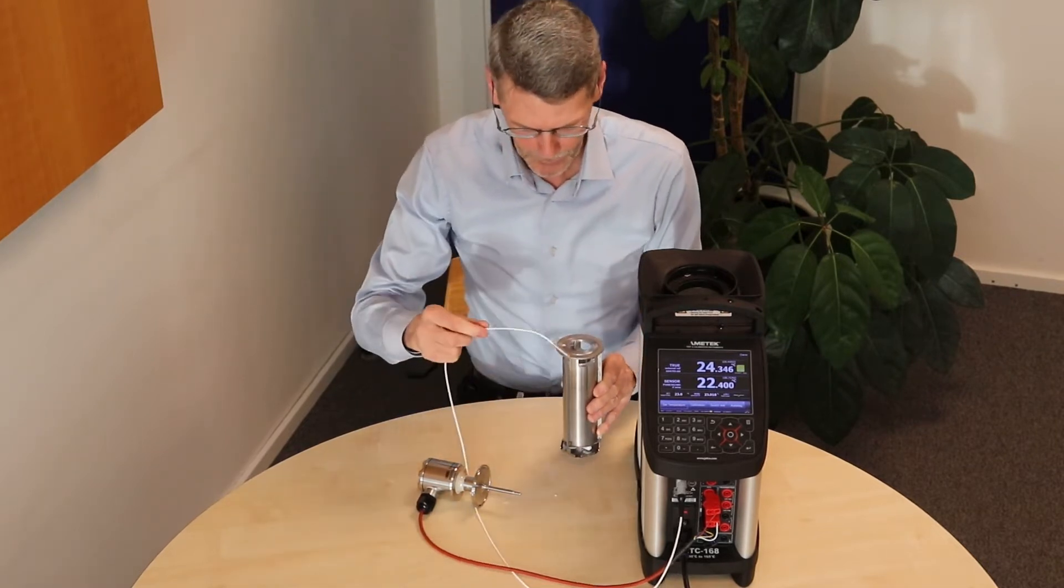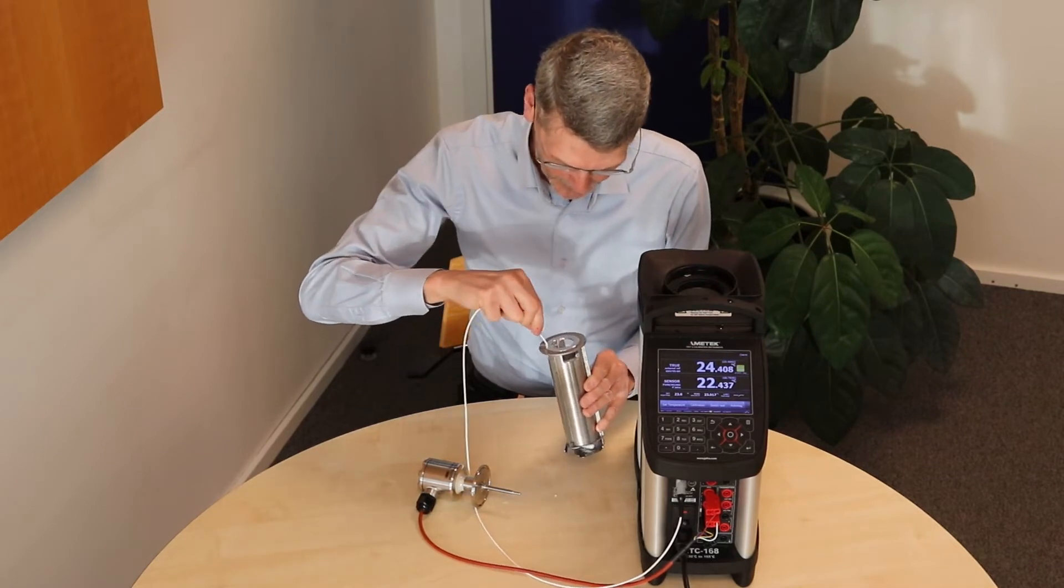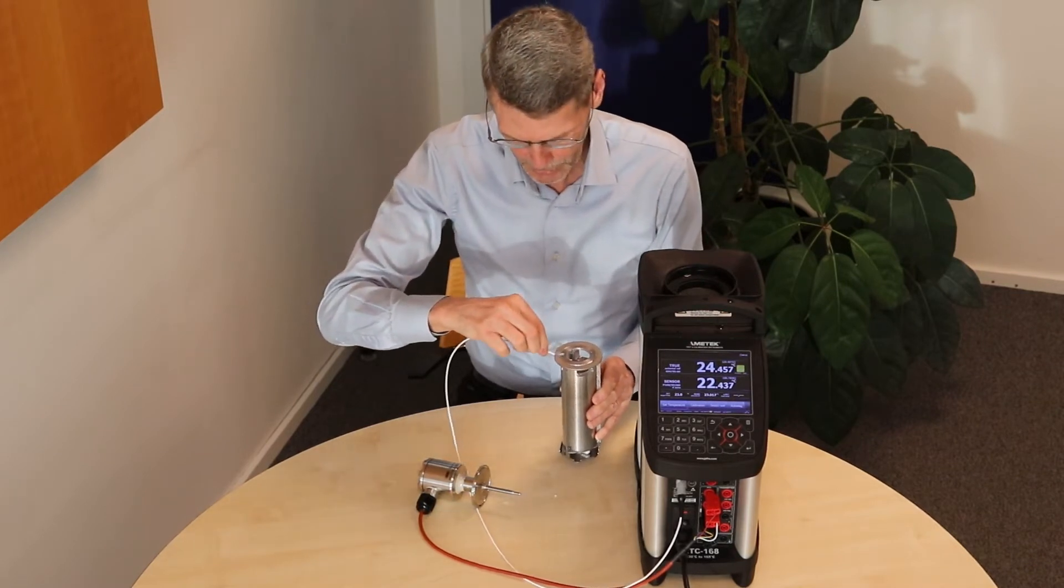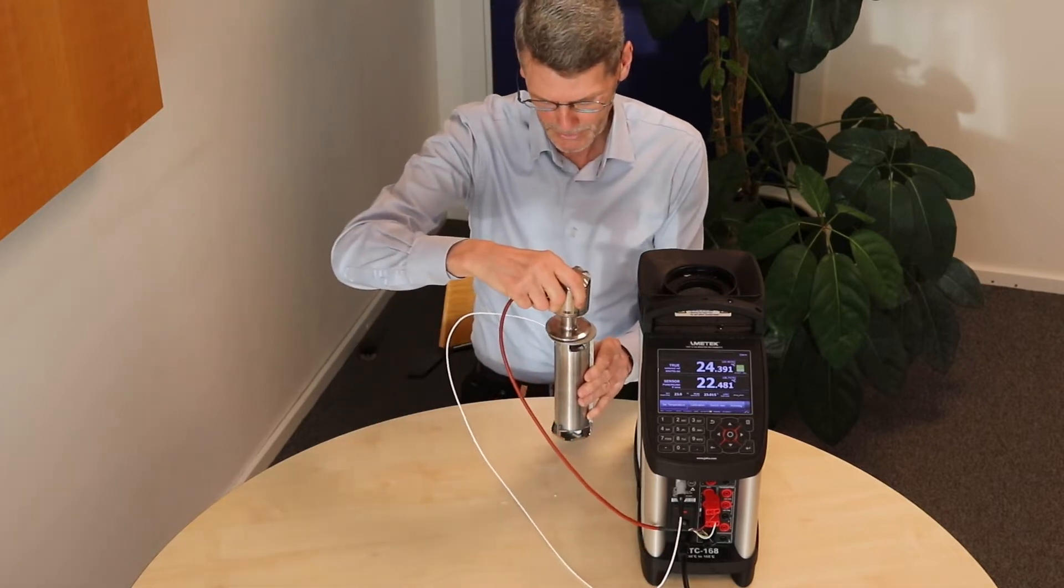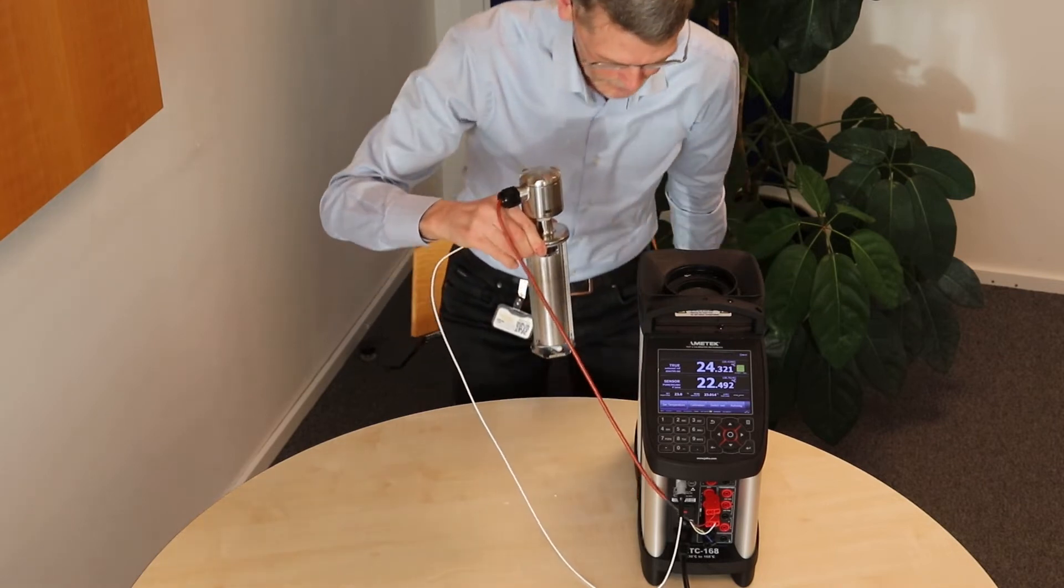Then we have the reference sensor, put in like this to be fixed-positioned. The sensor under test is mounted, and then we can put the system in the calibrator.